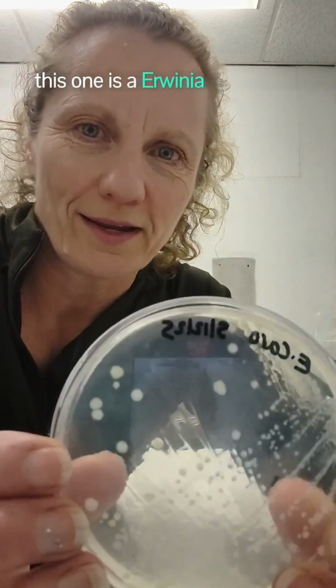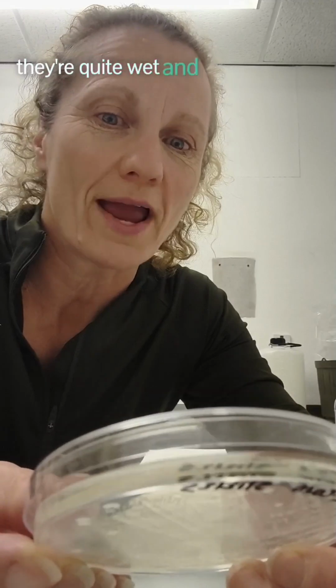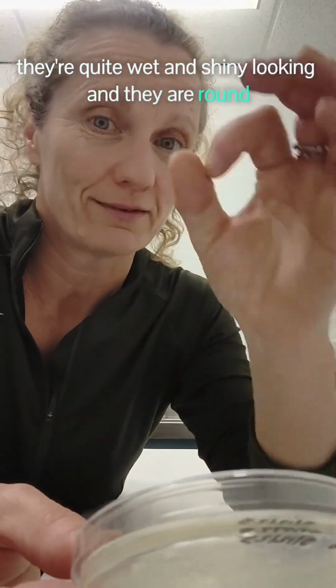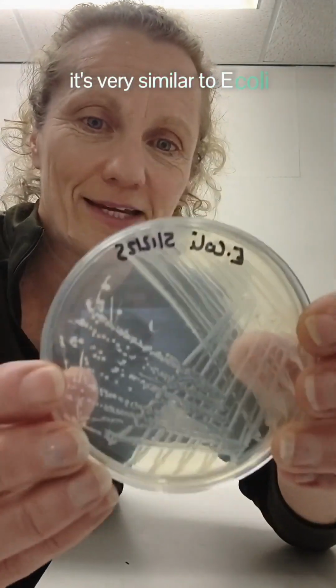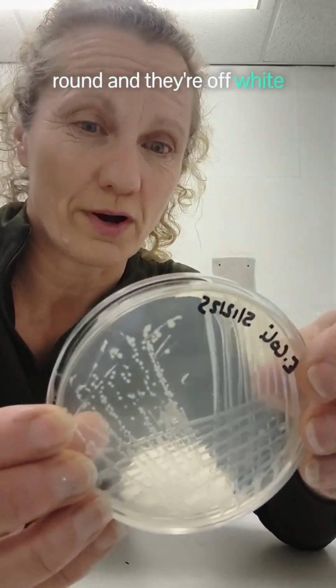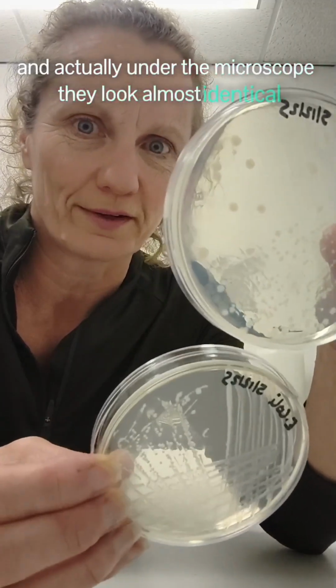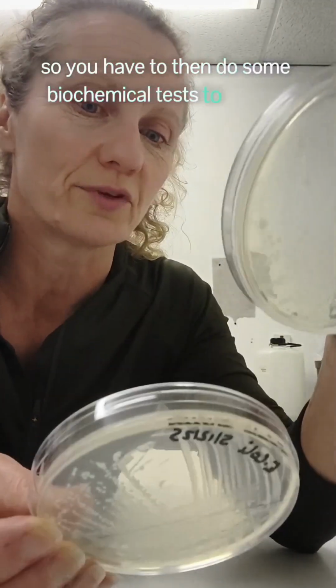Let me show you this one. This one is Erwinia carotovora. It's got these off-white colonies. They're quite wet and shiny looking, and they are round. It's very similar to E. coli, Escherichia coli. Again, the colonies are small, round, and they're off-white. So they look similar, and actually under the microscope, they look almost identical. So you have to then do some biochemical tests to be sure.